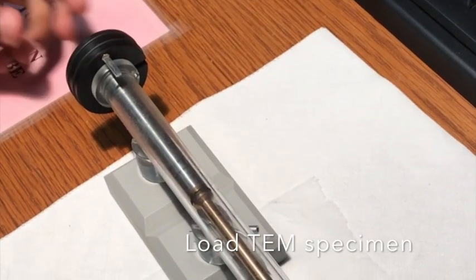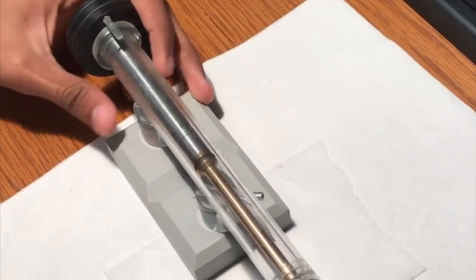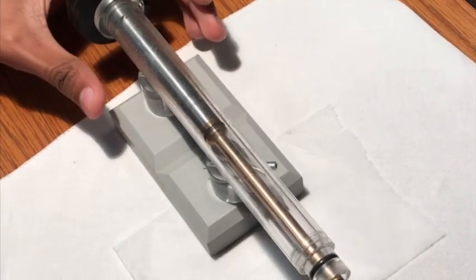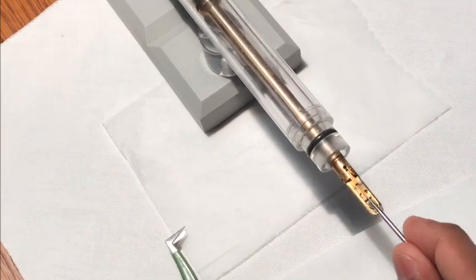This is a standard single tilt holder. To load the specimen, you use the pin to lift up the ring.